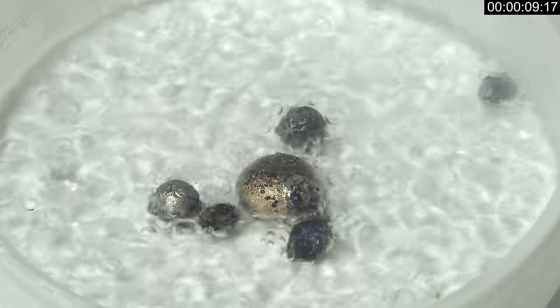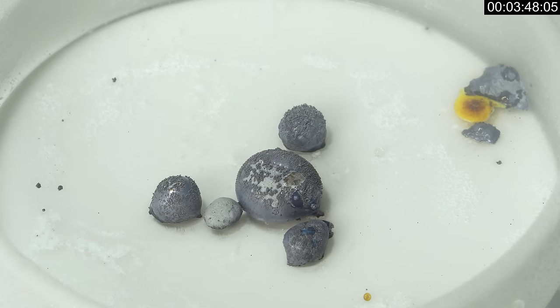When all the liquid nitrogen had evaporated, the alloy caught fire after a short time.